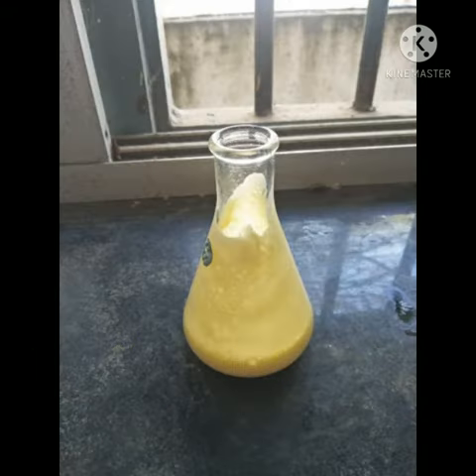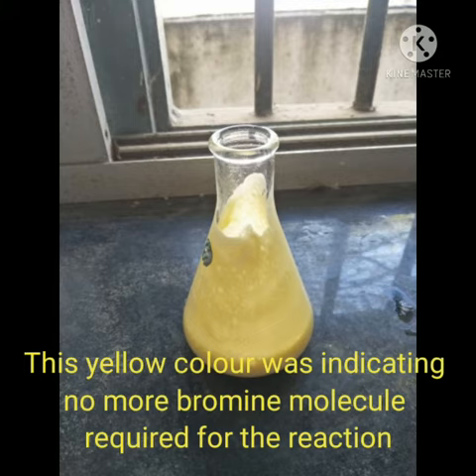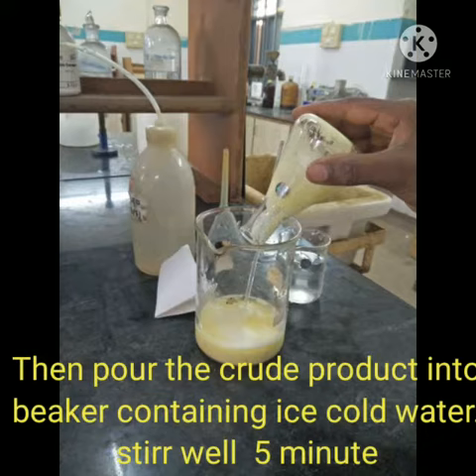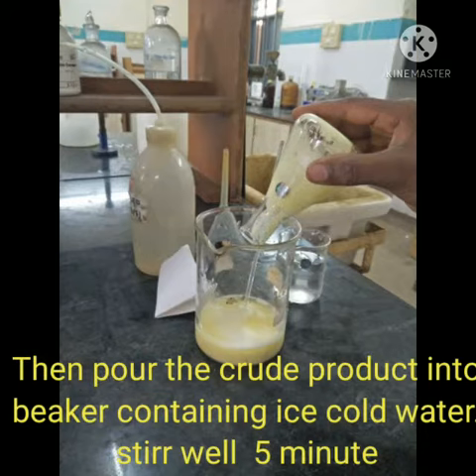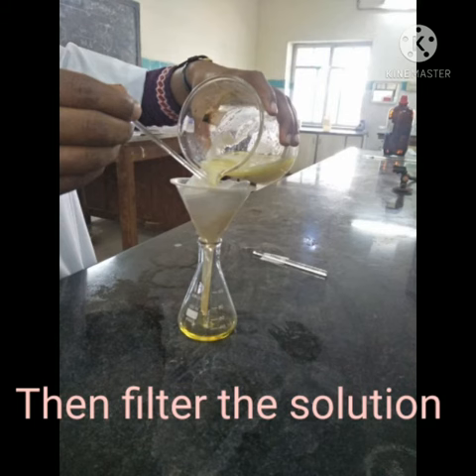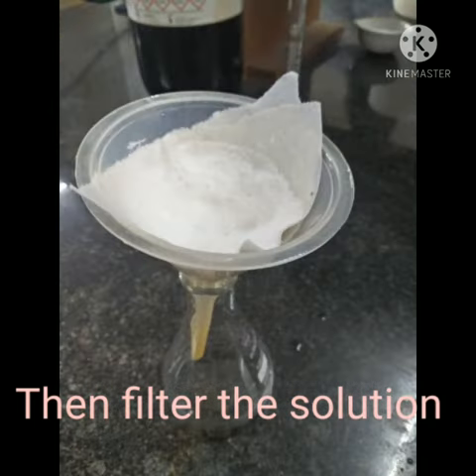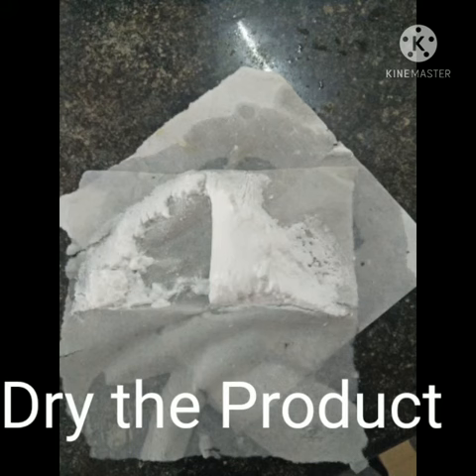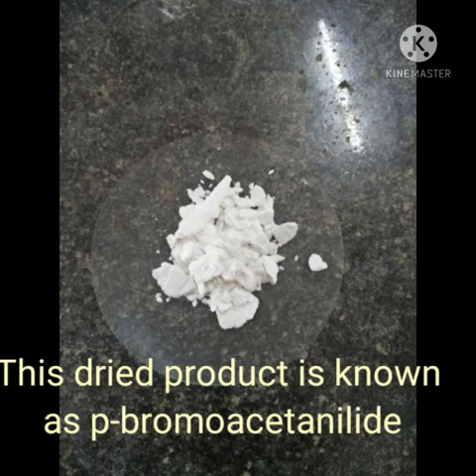The yellow color indicates no more bromine molecules are required for the reaction. Then pour the crude product into ice cold water. Stir well for a few minutes, then filter the solution. Dry the product. The dry product is known as Para-bromoacetanilide.